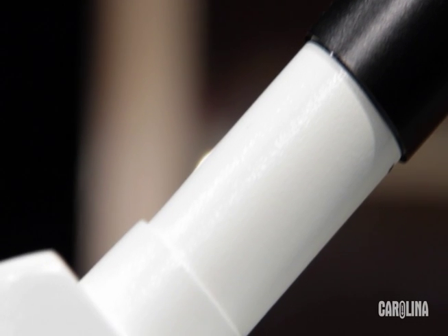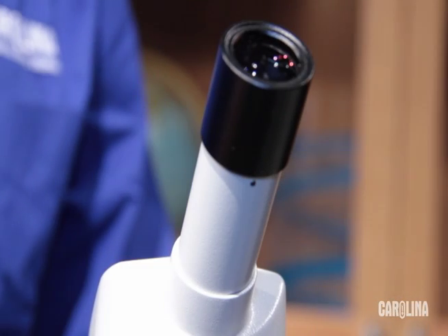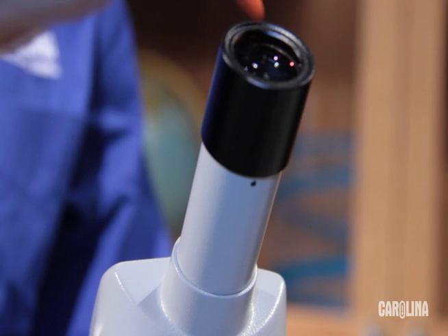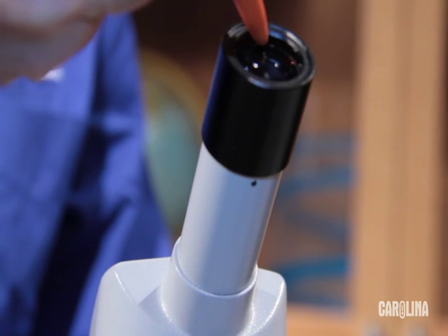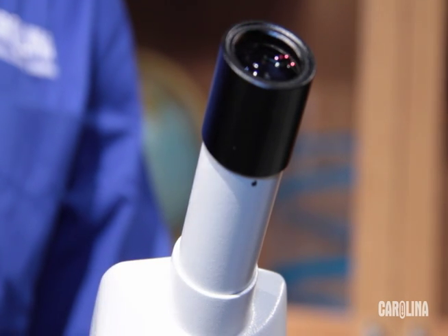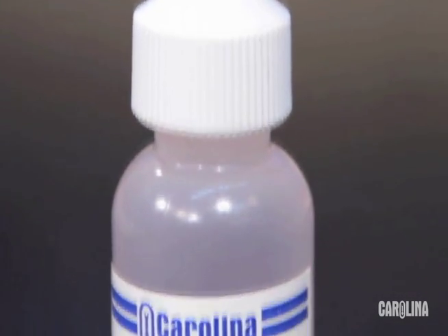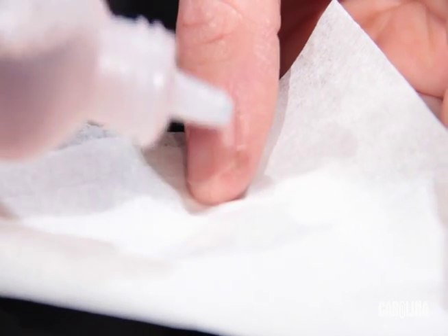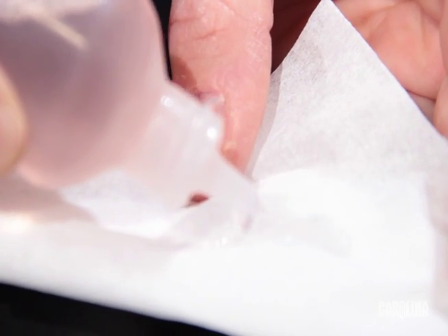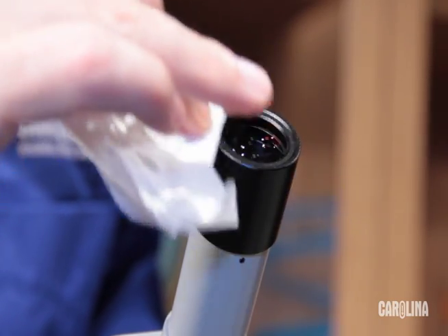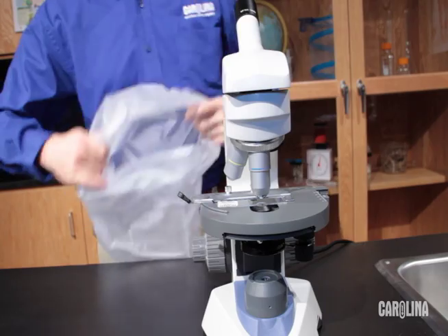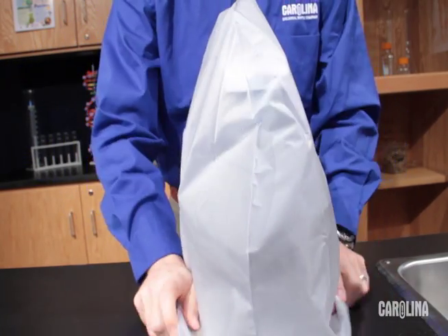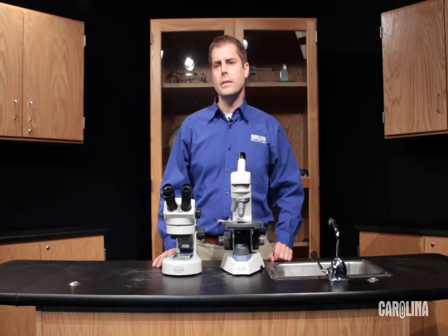Make sure that all the eyepieces are clean. You must have clean eyepieces in order to view the image clearly. If your eyepiece is dirty remove the loose dirt with a blower brush or camel hair brush. Then you can clean the eyepieces with an alcohol lens cleaning solution. Remember it's easier to apply the liquid cleaner to a tissue not directly to the eyepiece. To prevent your eyepieces and objectives from getting dirty or dusty keep the microscope covered when it's not in use. This same process can be repeated for the objectives if they are also dirty.